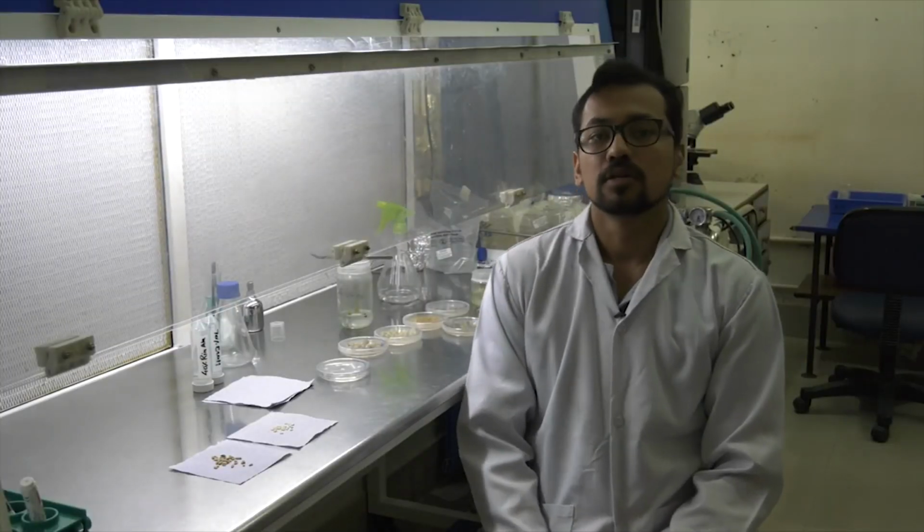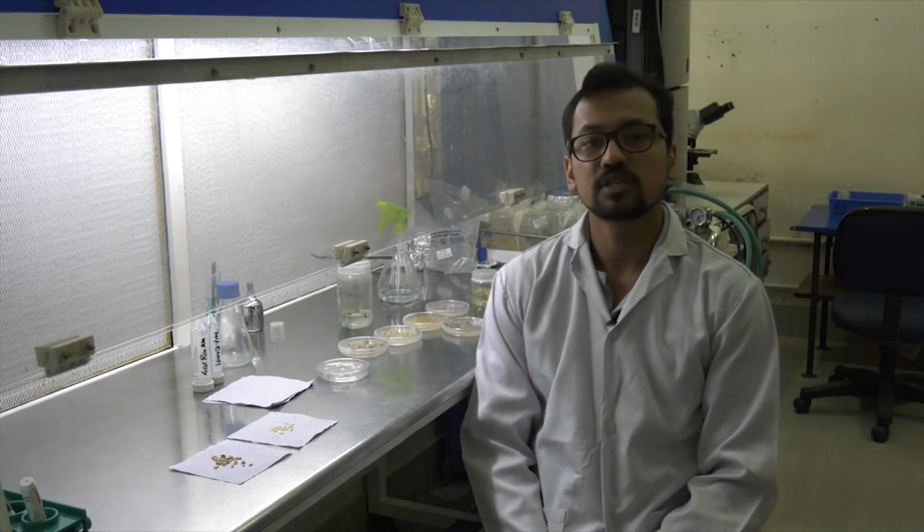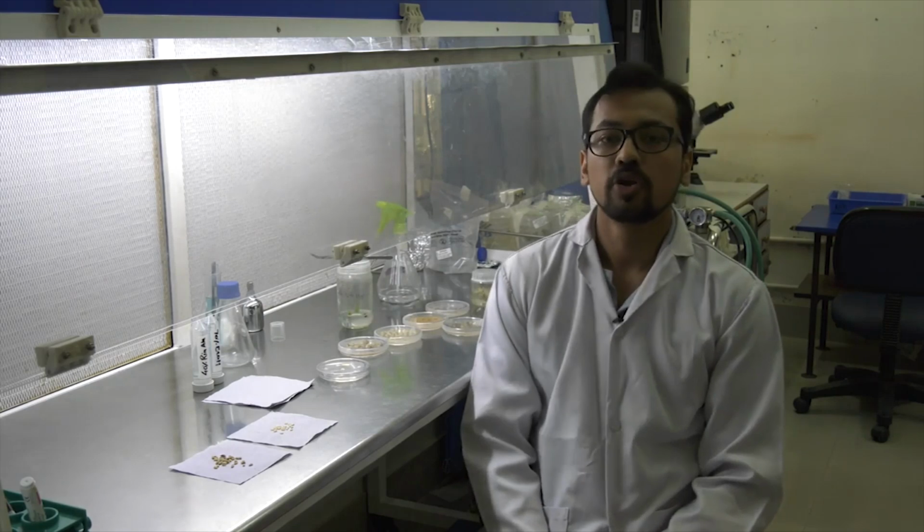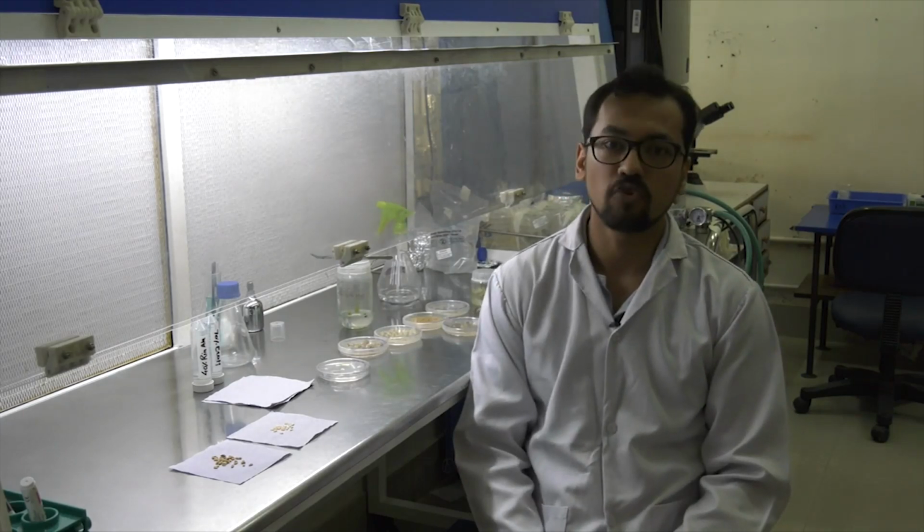Hello everyone. You have gone through the lectures and you must know that to study plant developmental biology, the genetic modification of plant is a very essential process. For genetic modification, the first thing that we need is an explant. An explant is any plant material which can be used to regenerate callus, and those calluses are then transformed using two methods.